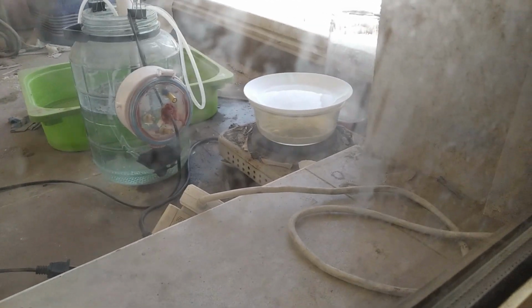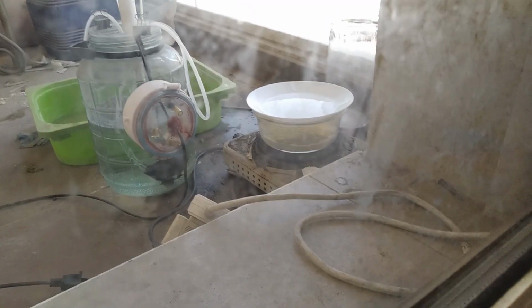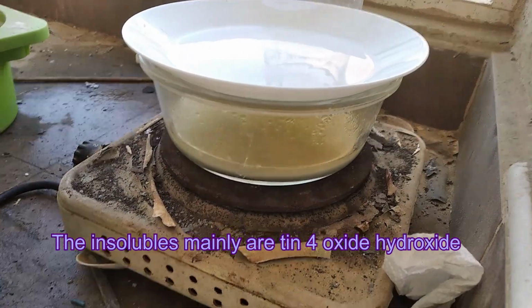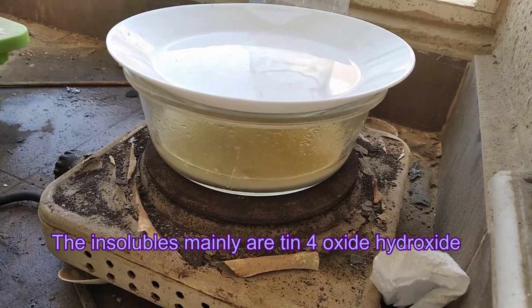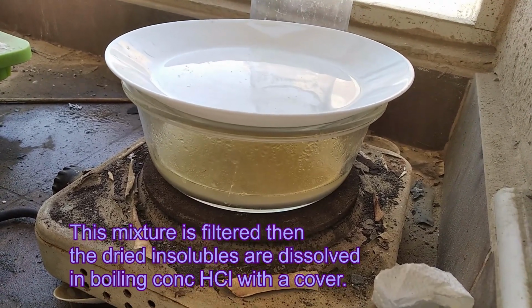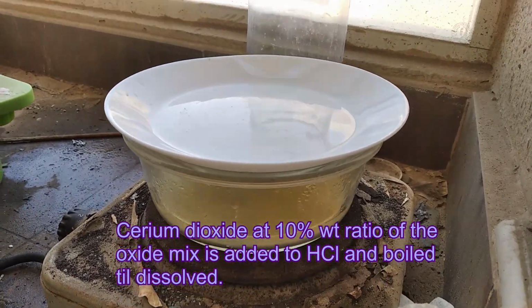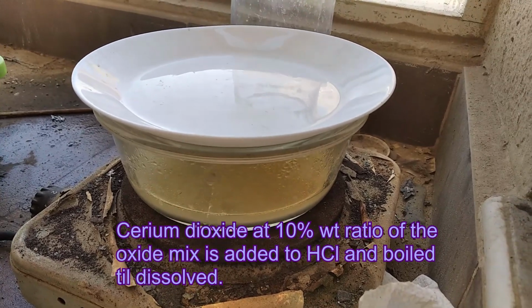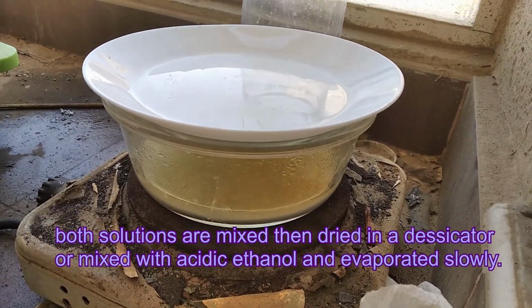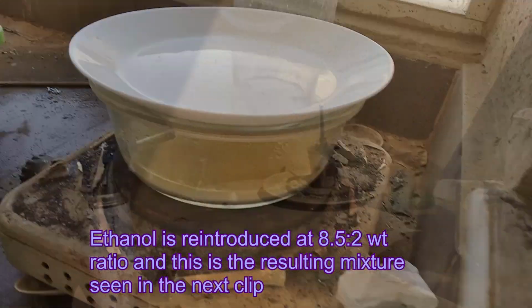Anyway, I don't care if I'm wasting nitric acid because it looks like I put way too much. But I can just make more. It's not that hard. That's exactly what I'm looking for. However, I barely used any acid, yet it completely dissolved, which is kind of good. So I'm just going to put this somewhere else. I already have some tin mixture that I've prepared by mixing some cerium into it and dissolving it in HCl, but now we're going to do the same with this.